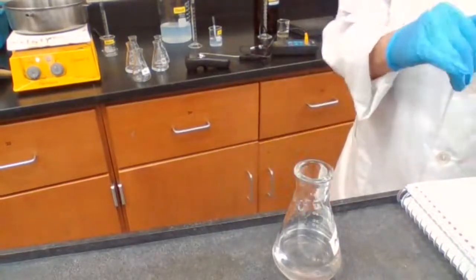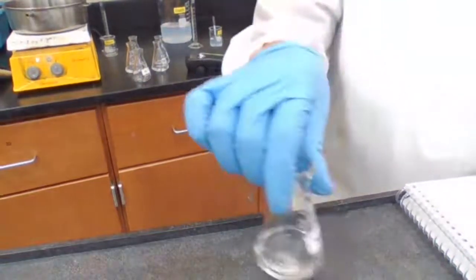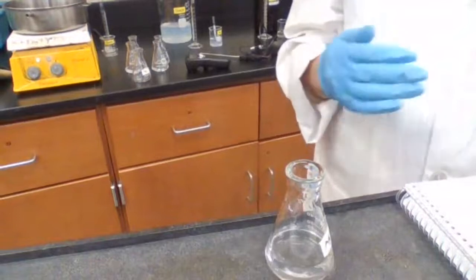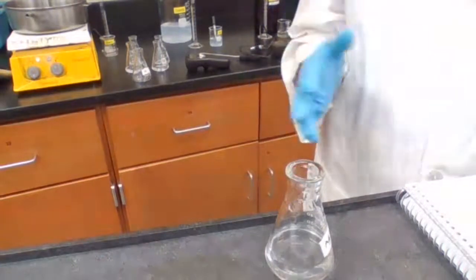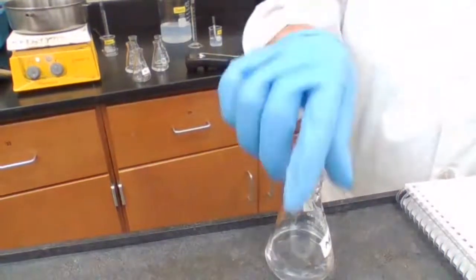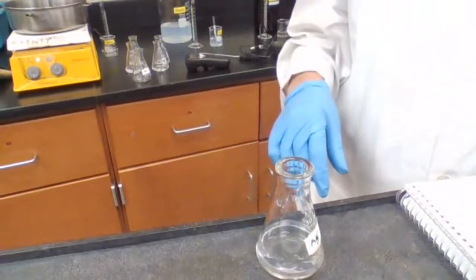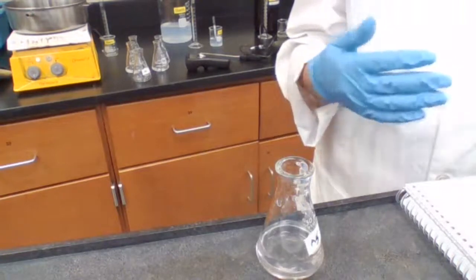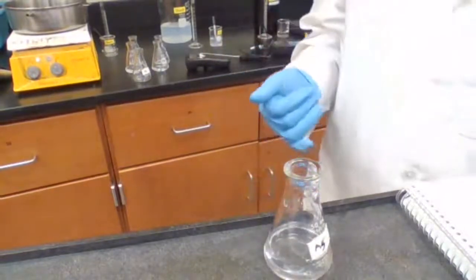So using trials 1 and 2, you find the value for X. Using trials 3 and 4, you find the value for Y. Now you have the value for X and you have the value for Y. Rate for all 7 of them is using equation number 19 in the lab manual for this experiment. We are trying to find the value for K, which is the rate constant at 3 different temperatures. Room temperature, of course, is going to take the longest.